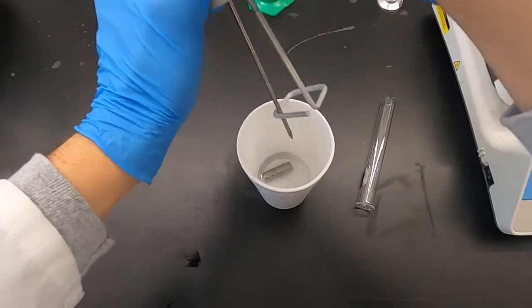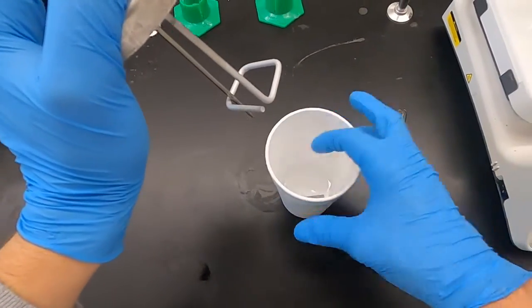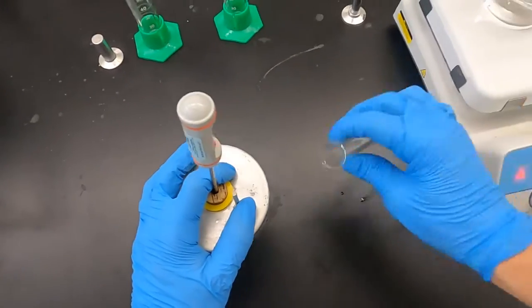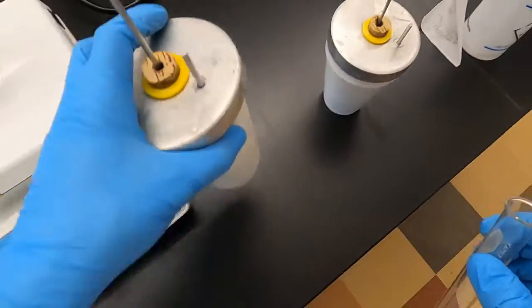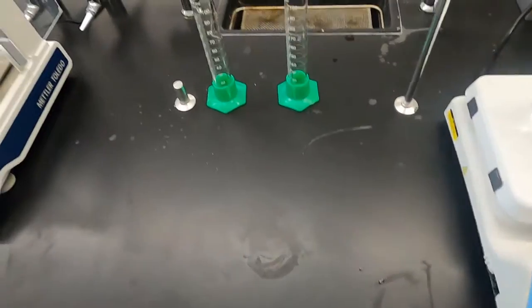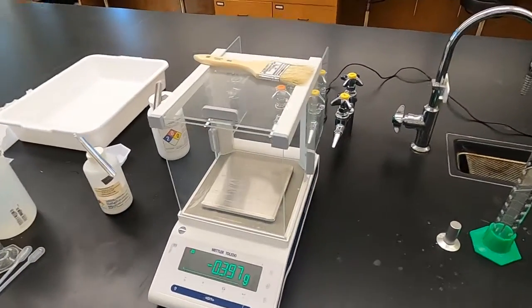I'm taking that off. I'm gonna feel this water. I'm interested. Yeah, not that hot. So again, that metal was just hanging out in an empty test tube in the water. So it's heating up all around it, but it's not like the metal is on the hot plate. So just something to keep in mind. So we are gonna get ready for part 3 of this.